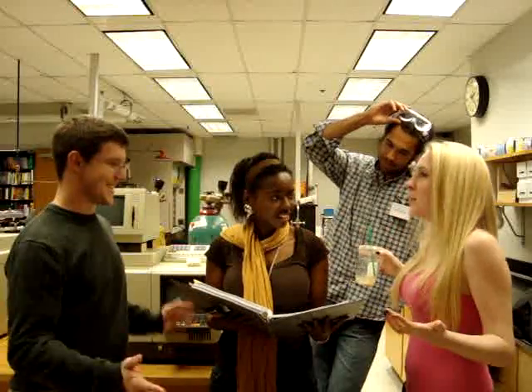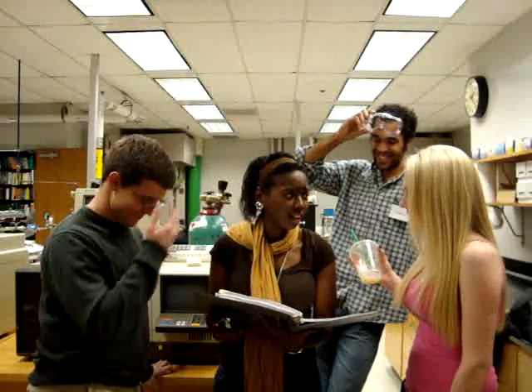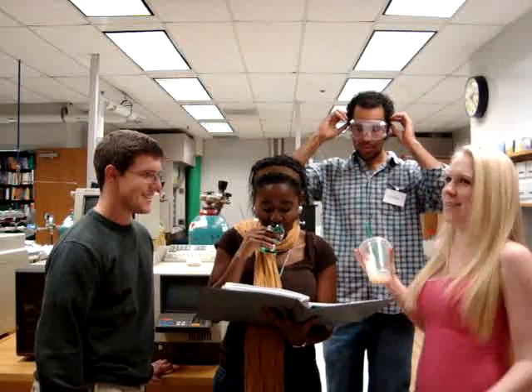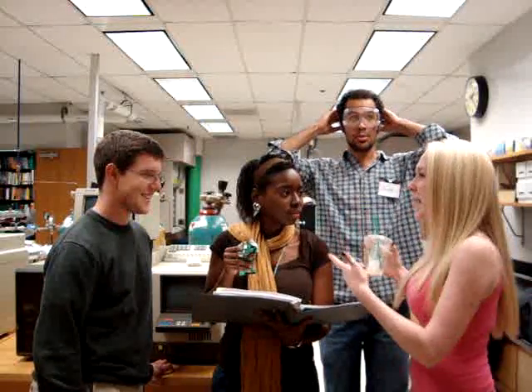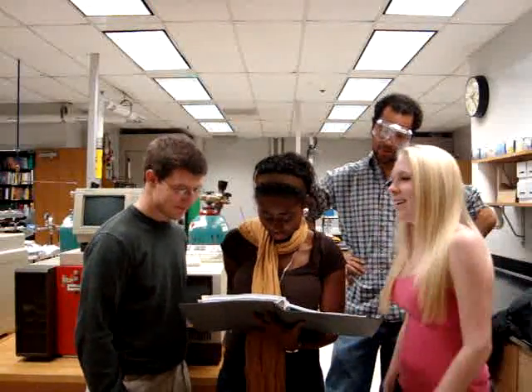Alexa! Oh my gosh, this is unacceptable. What? I know, I should have gotten a venti. Alexa, you're not allowed to drink in the lab. Hold on, if I can't drink in the lab, then you can't eat in the lab. Says it right there. I guess I gotta put this away. There it is. Yeah. Okay.